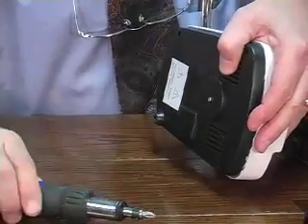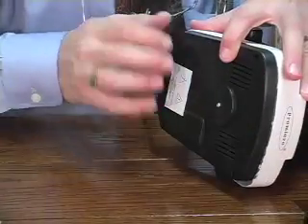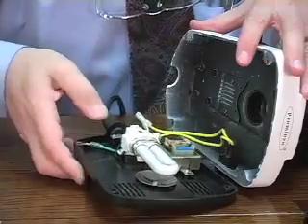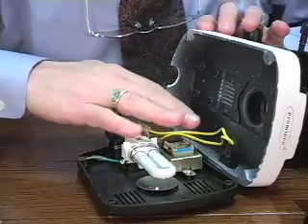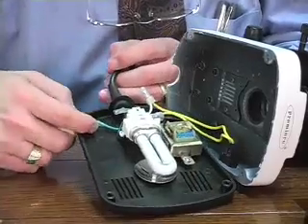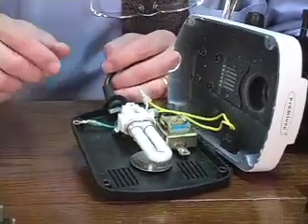It's a lot faster. Okay, when you've removed all 4 feet, gently remove the base. You'll see that there is a couple of wires from the on-off switch. Remember, we don't have any power. You can see why we would not want the power plug to be plugged in. There's also a ground wire here, which we have detached when we unscrewed the foot.